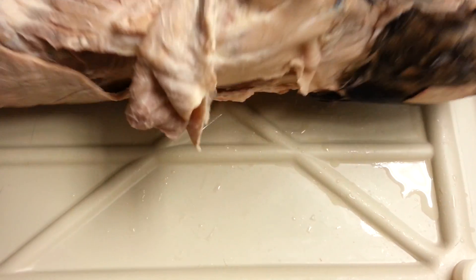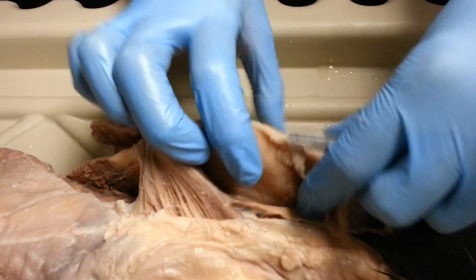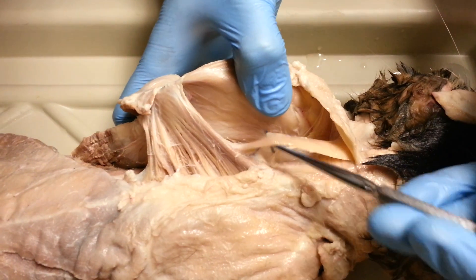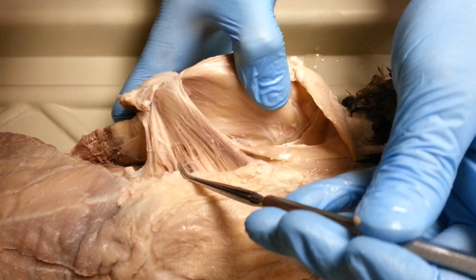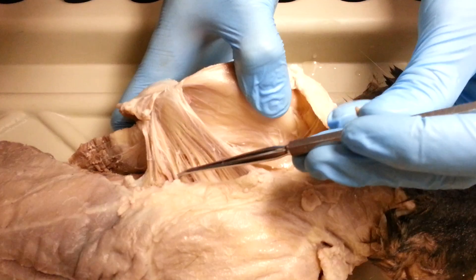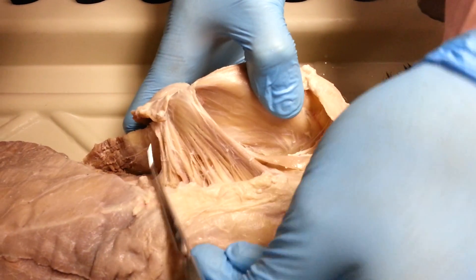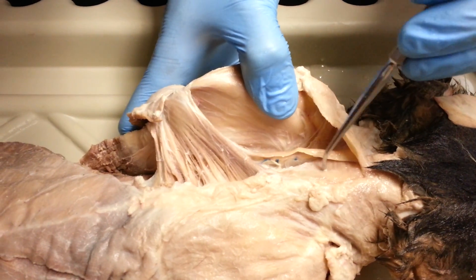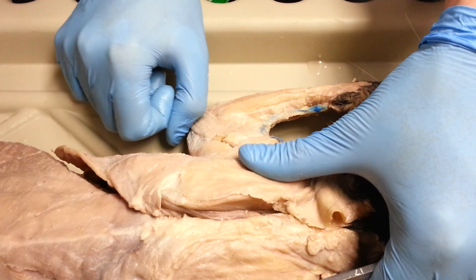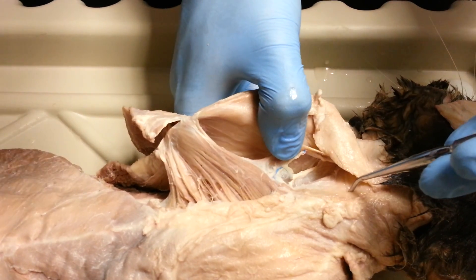Let's take a look at some of the ones on the upper body now. If I move this aside, we get a really good view of all the muscles on the inside. This one is rhomboideus capitis. This one right here is rhomboideus minor — at this line right here, I usually say this is rhomboideus minor. And this one right here is rhomboideus major. Then we have the splenius muscle right here. The capitis is actually this one up here, and underneath it is the splenius.